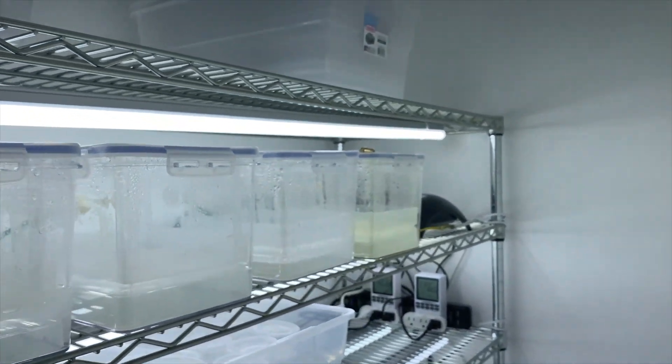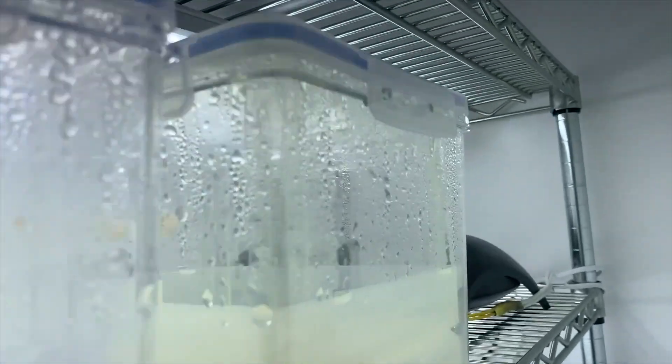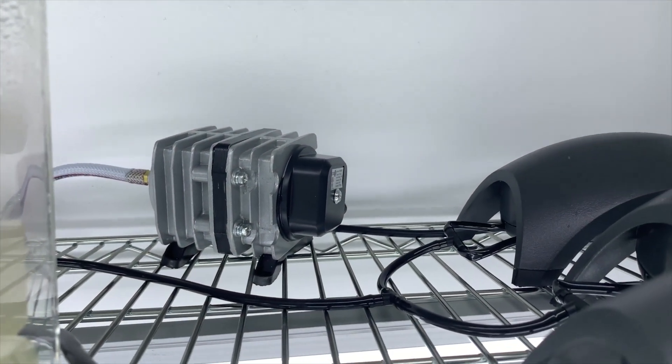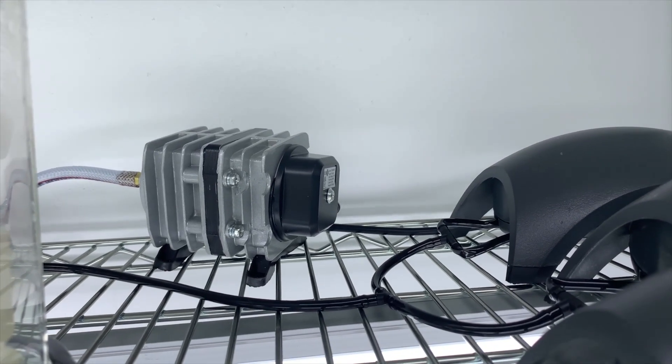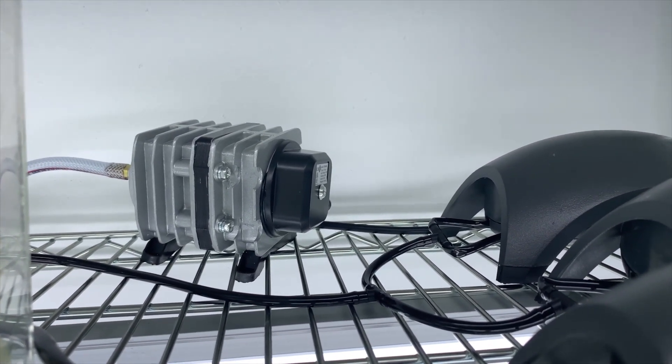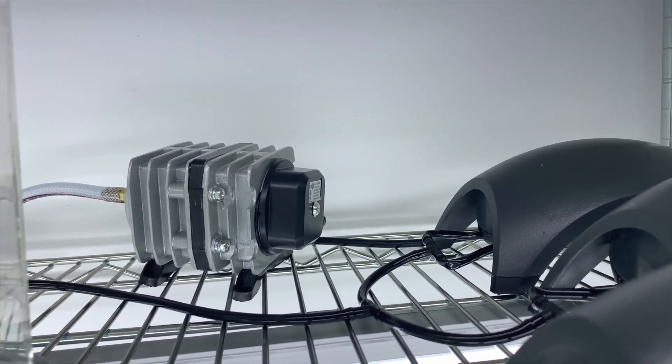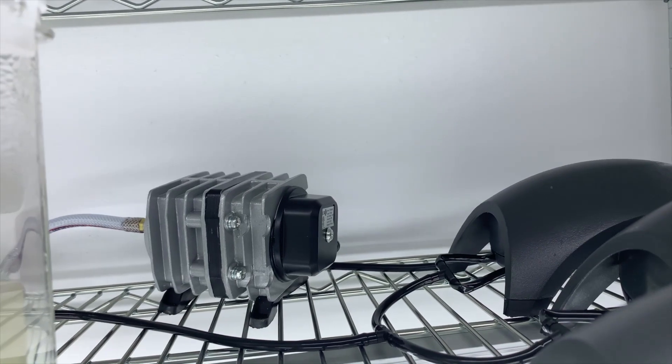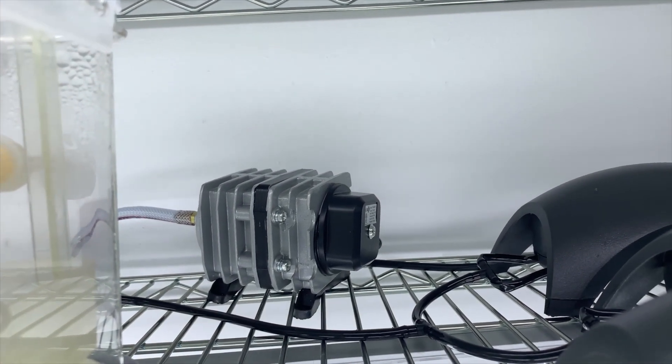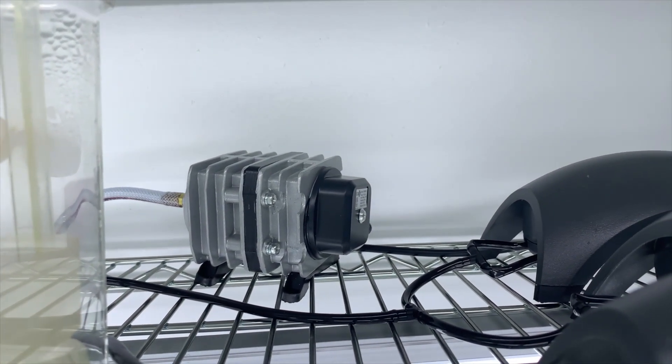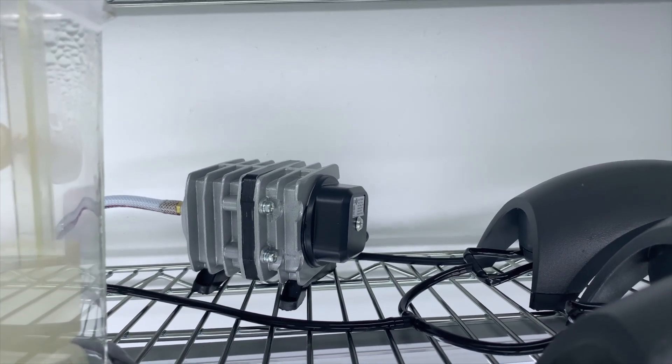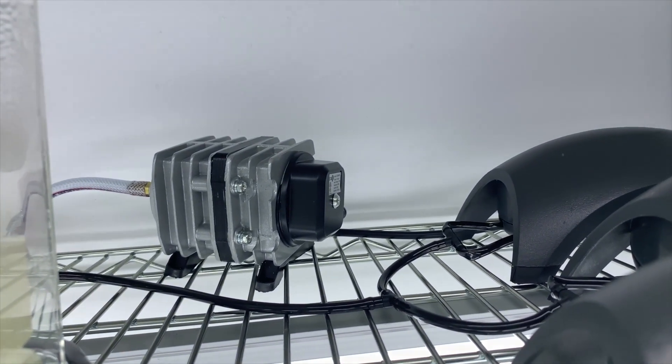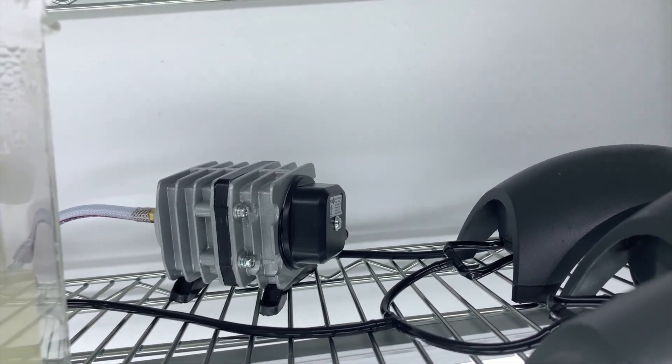Otherwise I may be able to use the other pumps, like the one in the back. Those are more powerful pumps. However, for this setup, I think I'm okay with these other pumps. And I will use that pump, and I have another one of those identical to that one, also for the other setup, which I probably want to set up within the next month or so. Hopefully we'll see how it goes, if I can find everything that I need.